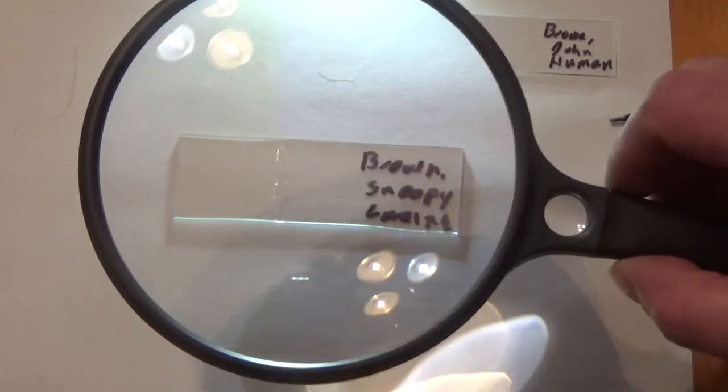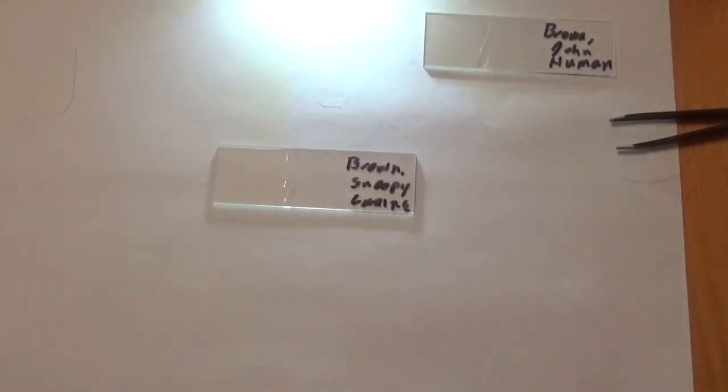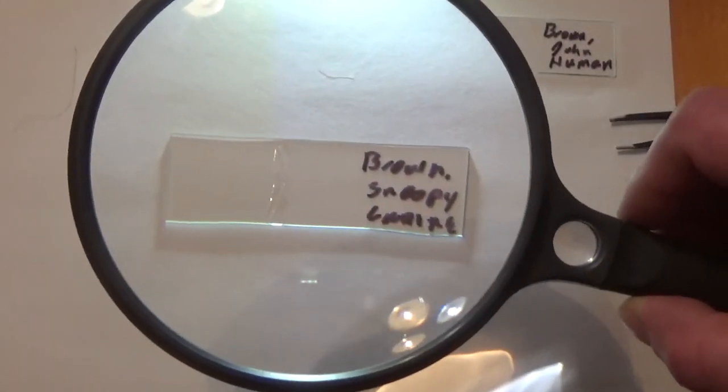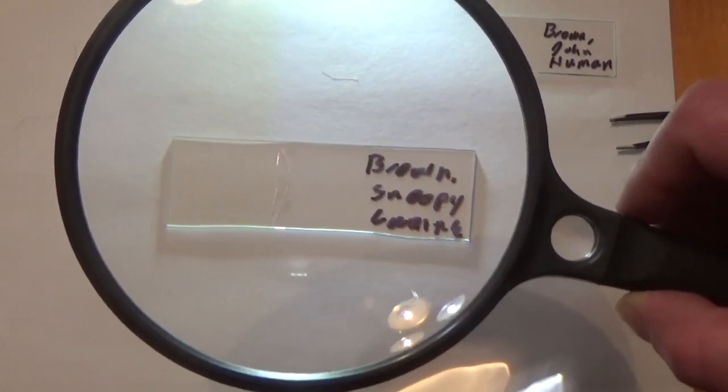So we're looking at it macroscopically with the naked eye. We're magnifying with low power here. But to really view the impression of the hair, we have to look at it under the microscope. So those will be the slides included in this lab exercise.